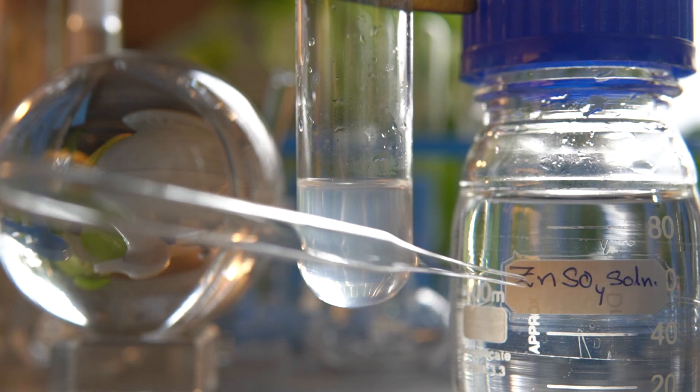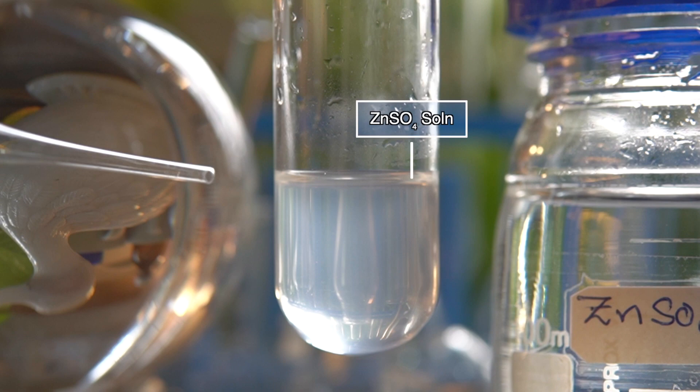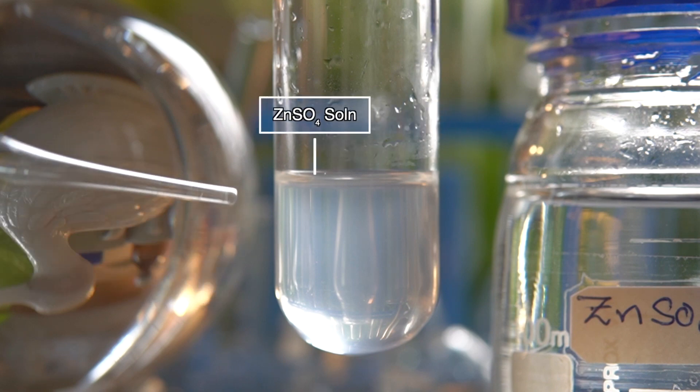Now to initiate the chemical reaction, we will take a clear solution of zinc sulfate into this test tube.